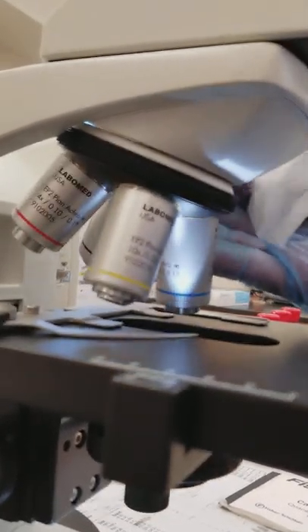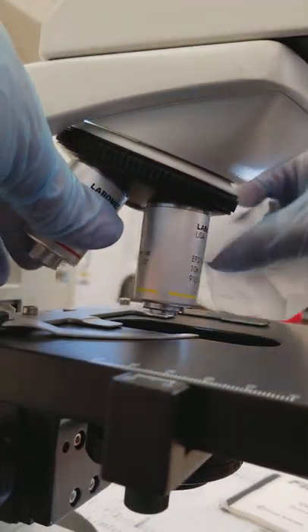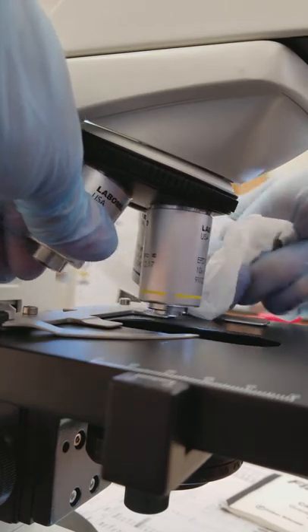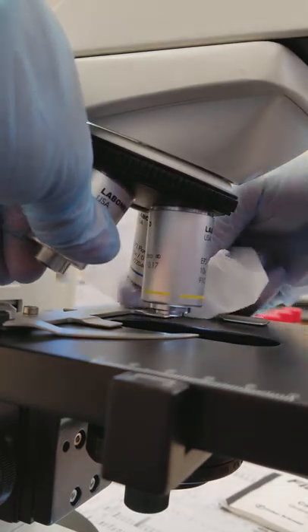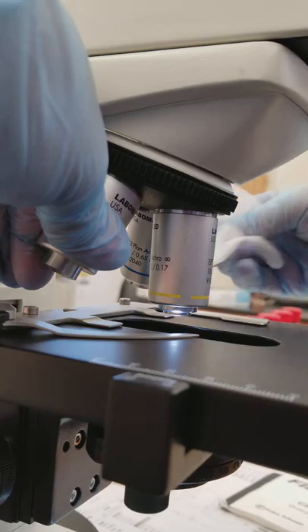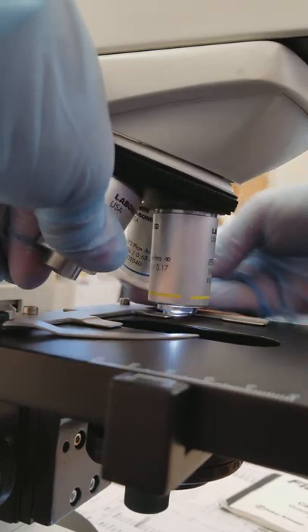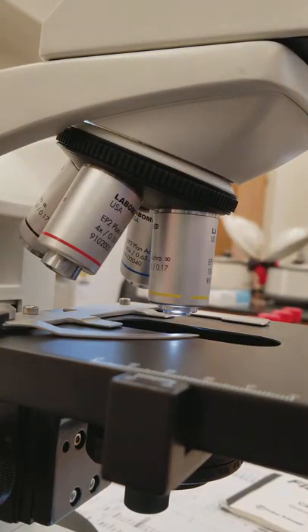I'm going to clean the 40 as well because I'm not sure that was cleaned properly. And dry it off, and that should be good. Another common problem that I noticed is when students go and put the microscope away.